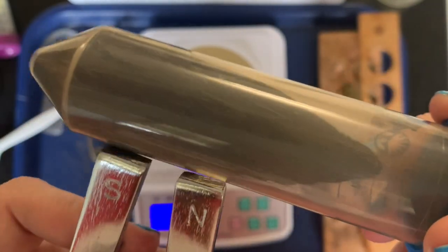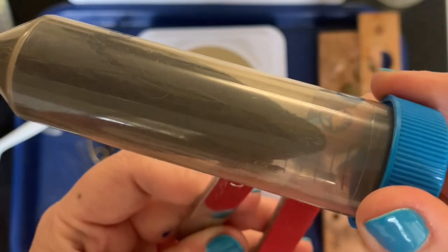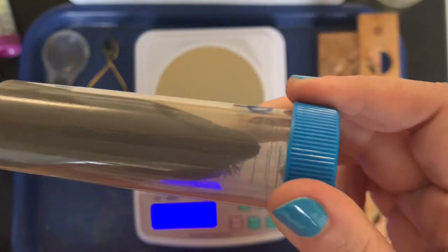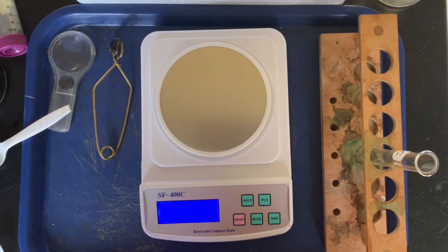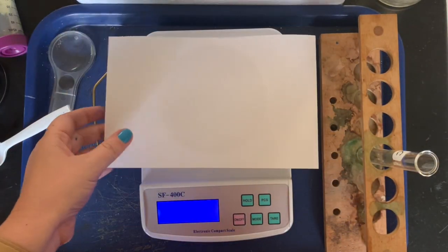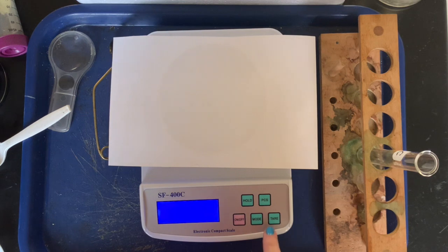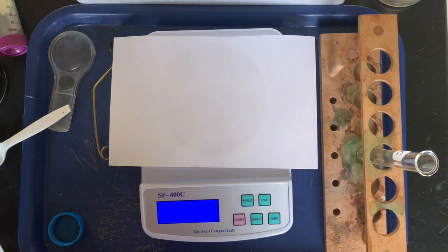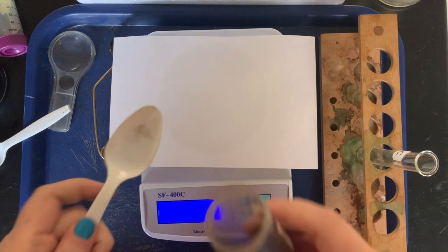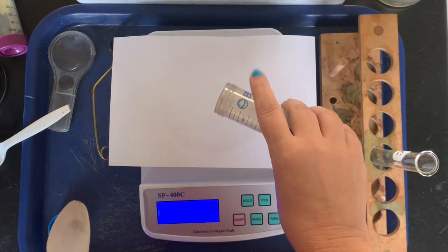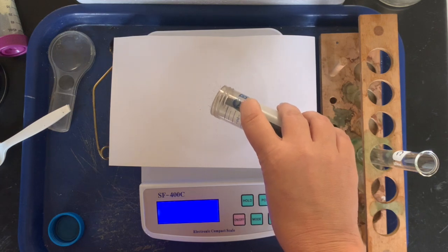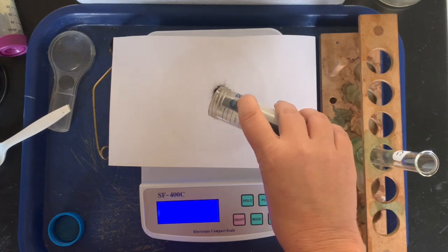See if I can make this work through the tube. We can definitely show you on the paper when we put it on the paper. So we'll do that in a second. All right, so we need seven grams of iron. So same thing, I'm gonna put my paper on the scale first and then I'm gonna hit the tare button to zero it out, and then I'm just gonna start adding iron. Now iron is a lot more dense than sulfur, so even though it seems like seven grams would be more than four grams, you don't need that much. So I'm gonna try and pour it really slowly, get to my seven grams, maybe not that slowly.